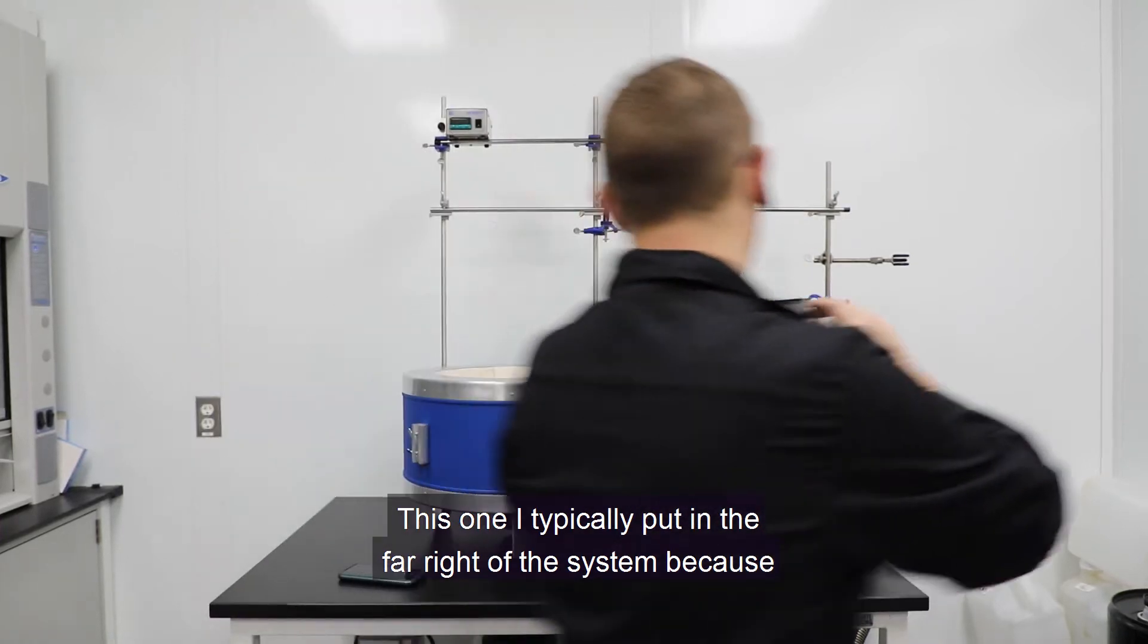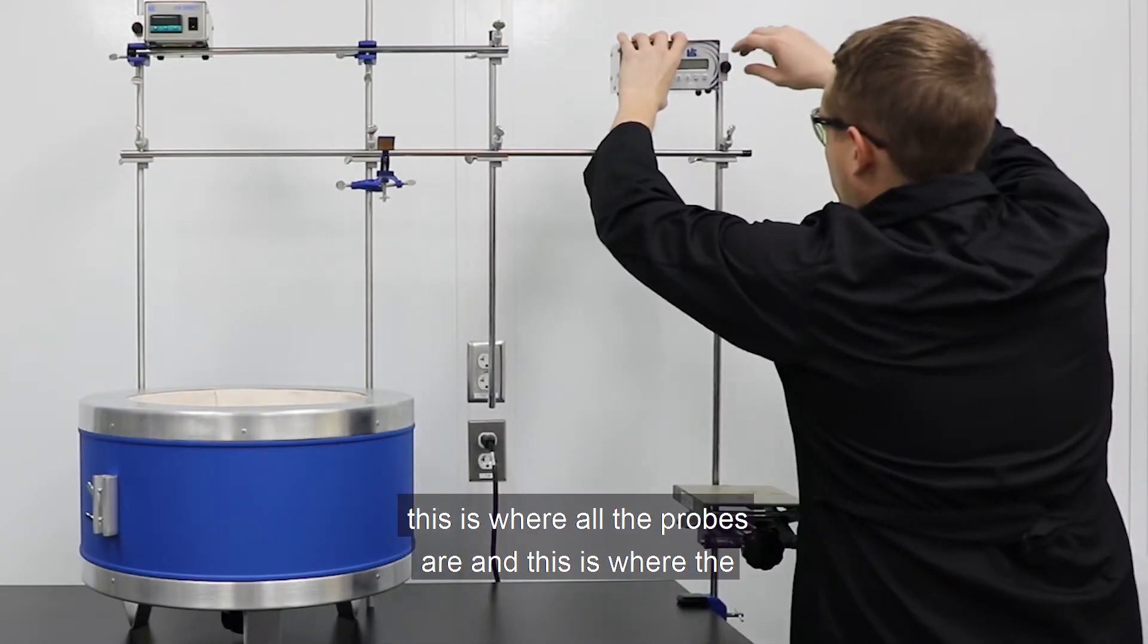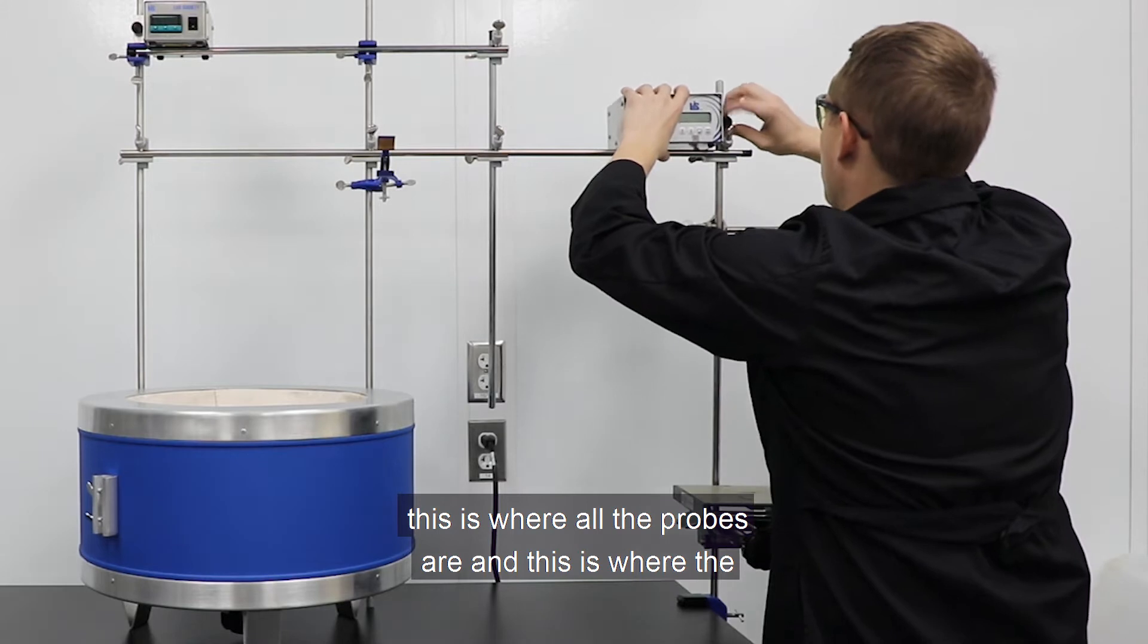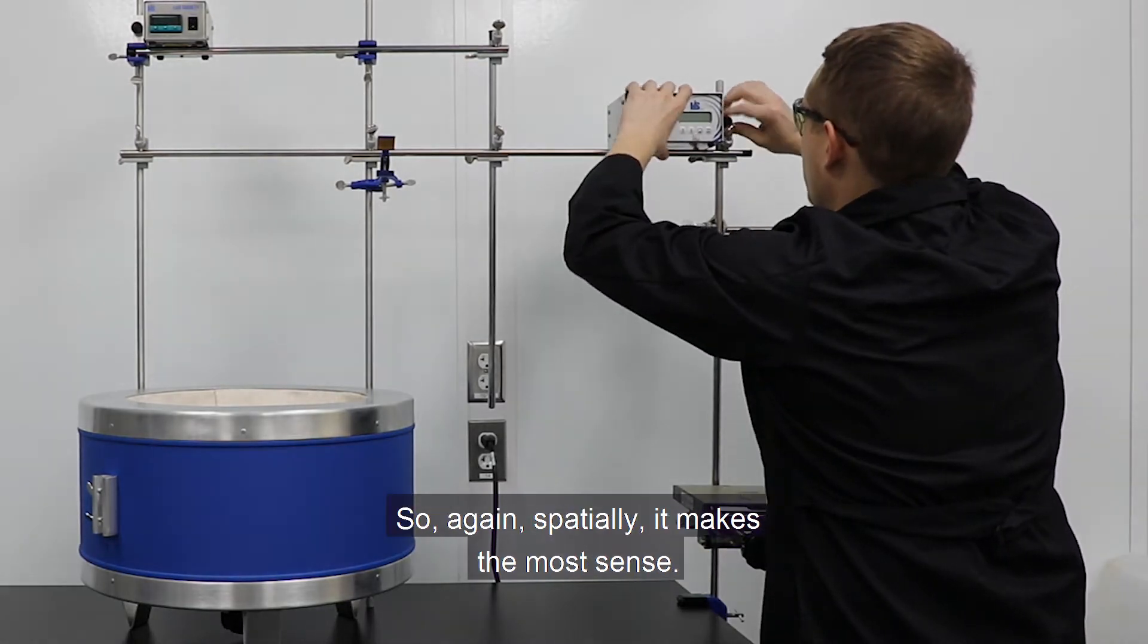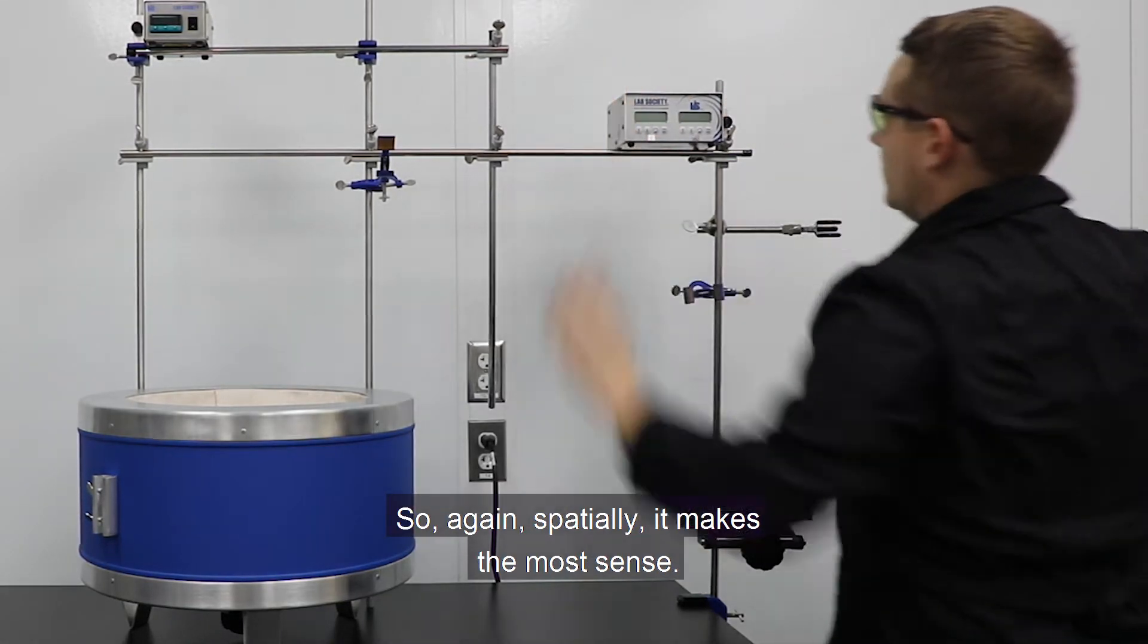This one I typically put in the far right of the system because this is where all the probes are, and this is where the vacuum system attaches to the system. So again, spatially, it makes the most sense.